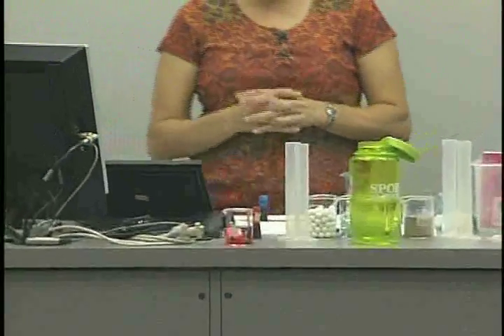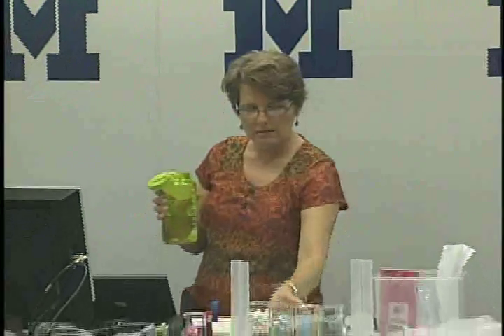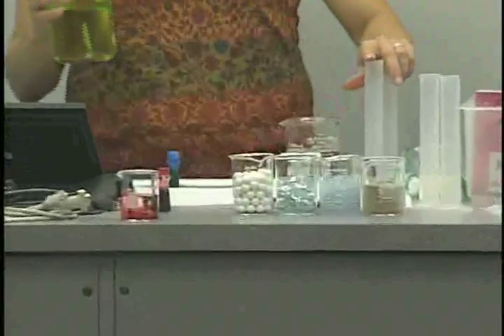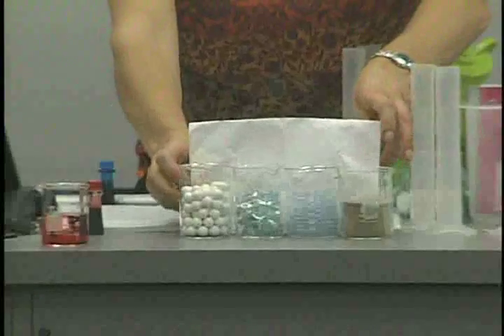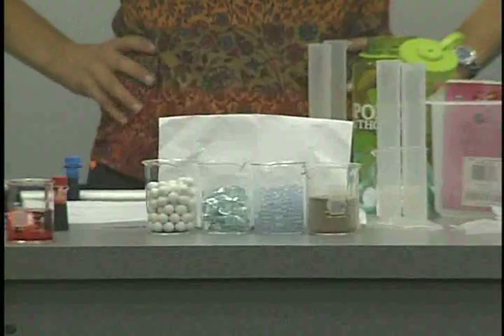The next question that we're going to try and answer in experiment 2 is: is there space between particles of solids? So I think, again, we might be better off just zooming in on this section here. And students, I tried this morning in the lab, and the results I got were very, very interesting. So what I did is kind of expand the experiment.